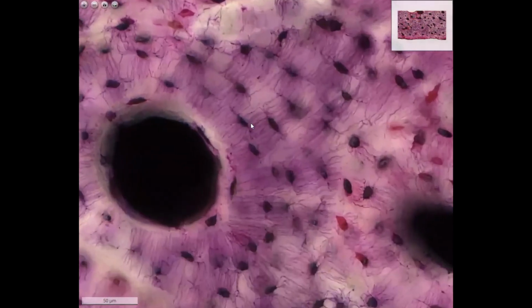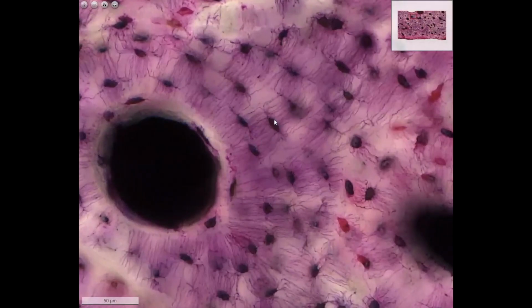These lamellae are crossed by the processes of the osteocytes, from which you here see only the so-called canaliculi. In these canaliculi, the processes of the osteocytes were hosted, and two neighboring osteocytes meet through the processes with gap junctions about at this level.